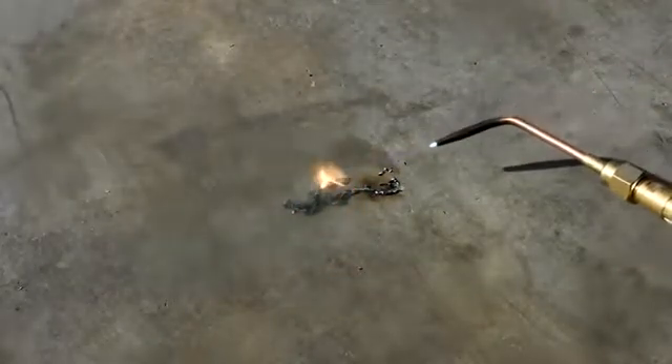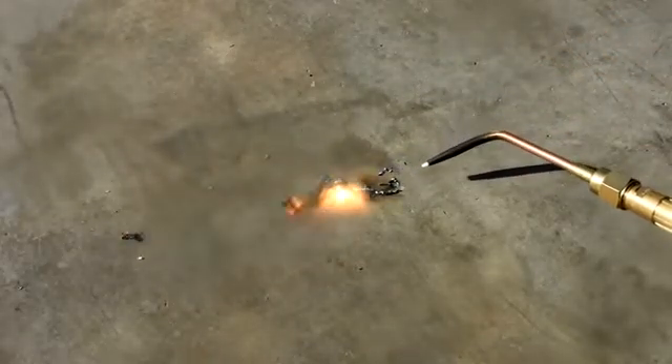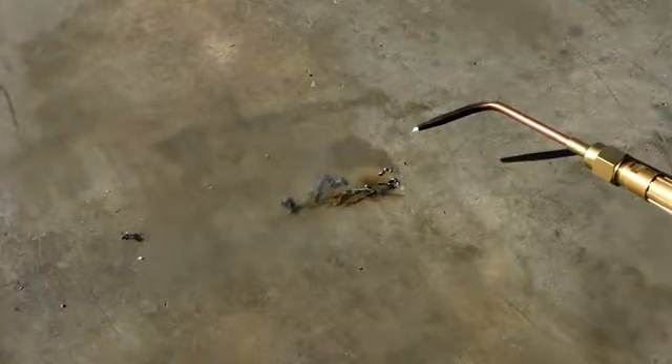In the next demonstration we are going to look at titanium dioxide, and we are going to have a go at making some titanium dioxide by oxidizing some of the swarf generated from our earlier machining operation. To start the reaction, we are going to heat the titanium using a gas torch. Once you heat titanium metal beyond around 800 degrees Celsius, the titanium will actually dissolve its own oxide from the surface into the bulk of the metal, and as a result a fresh oxide is formed.